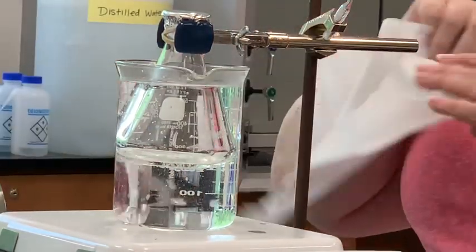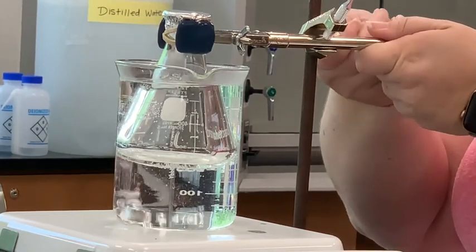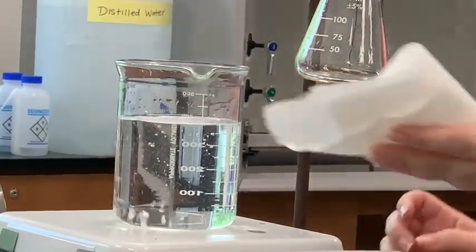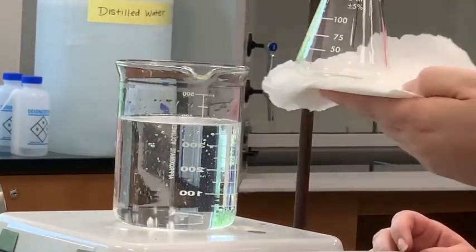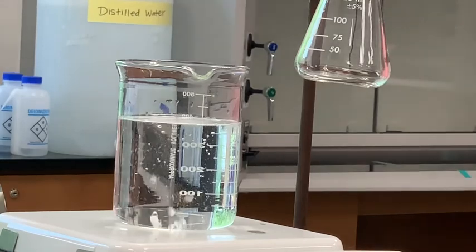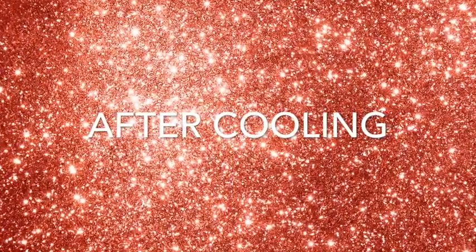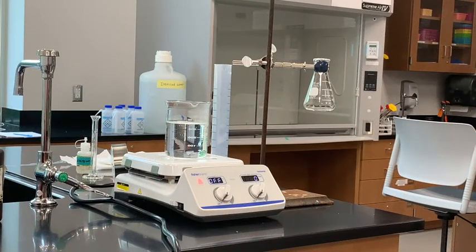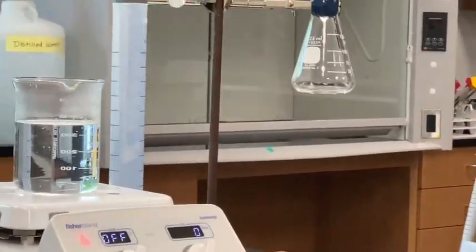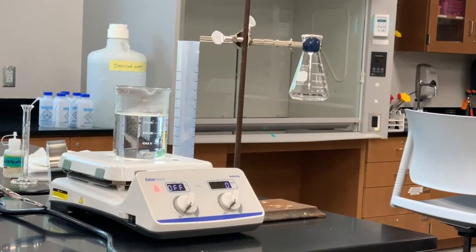Our four minutes is up. I'm going to check this again — I'll wipe this with a paper towel just to make sure it's not water I'm seeing. I think all my stuff hasn't been vaporized yet. I do see quite a bit of condensation around the neck; I'm not sure everything got vaporized. I think this is good — I'm just going to let this cool. Our sample has been allowed to cool. If you see some liquid inside the flask, it was supposed to condense back. So now I'm going to take it off the ring stand, take it back to the balance, and get the mass so we can calculate the mass of our vapor.